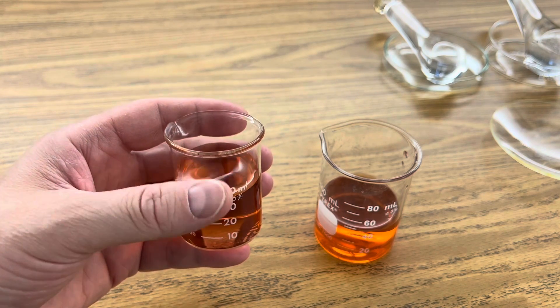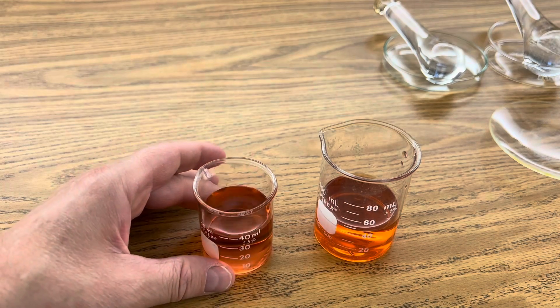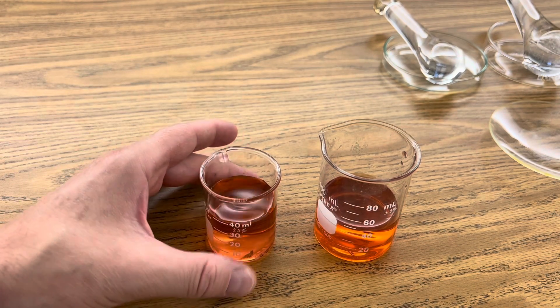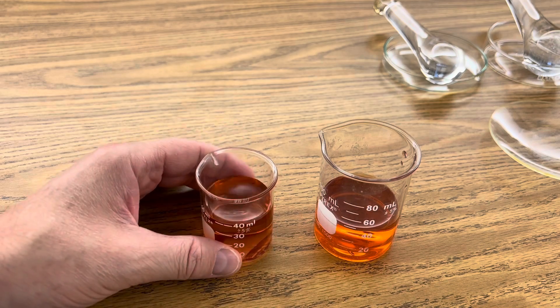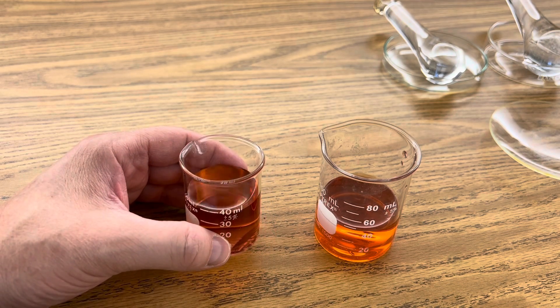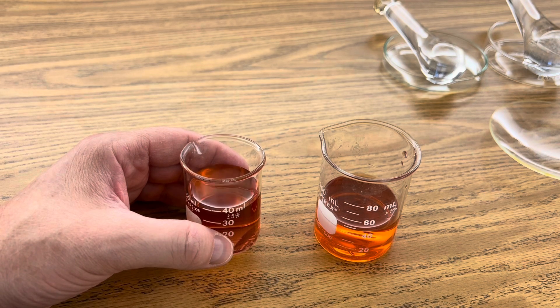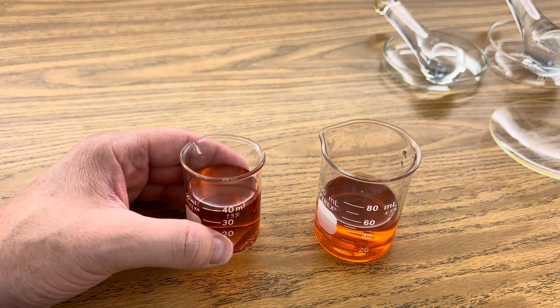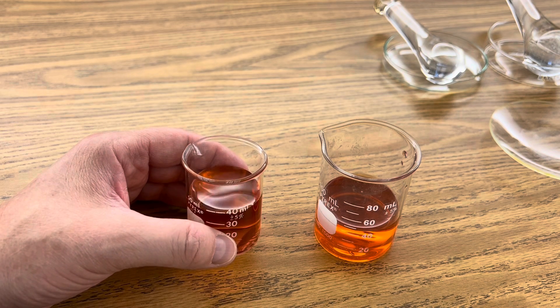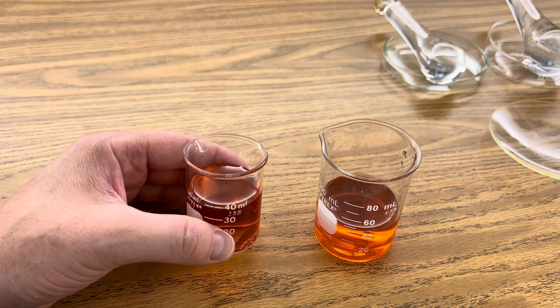This is used to perform the Scott test because cobalt thiocyanate changes from pink to blue in the presence of cocaine. Now of course I don't have cocaine here, but I do have Benadryl and aspirin. Interestingly, the Scott test gives a false positive in the presence of Benadryl — it turns blue. We'll compare that to crushed aspirin where there's no change and it remains pink.